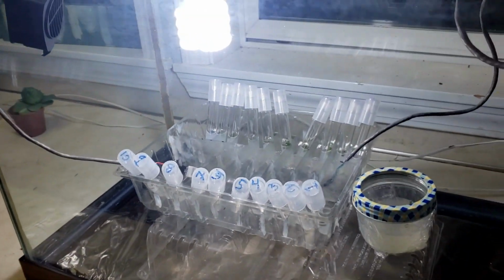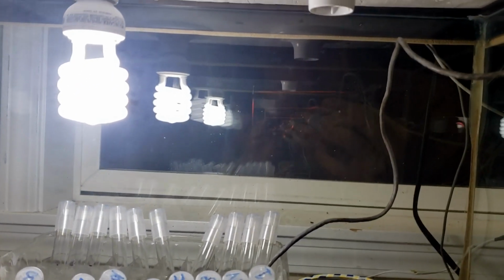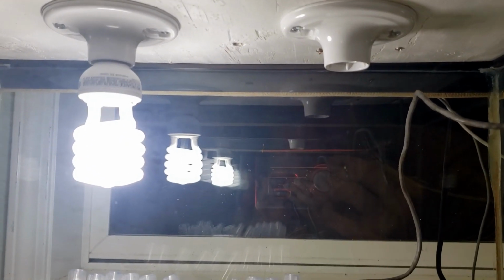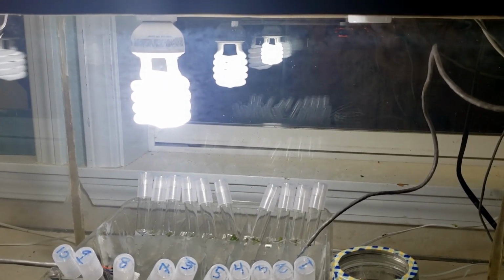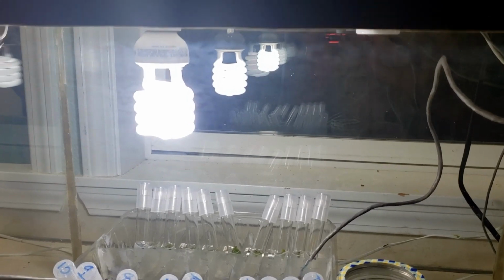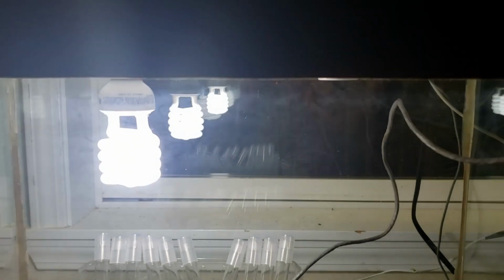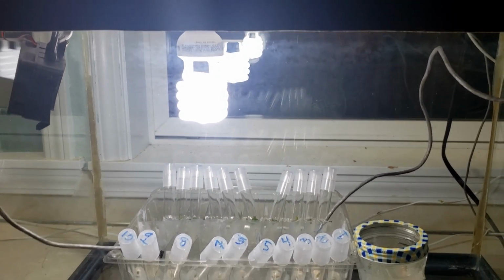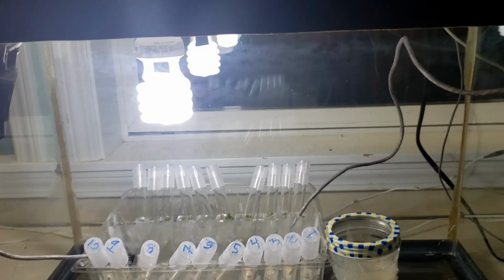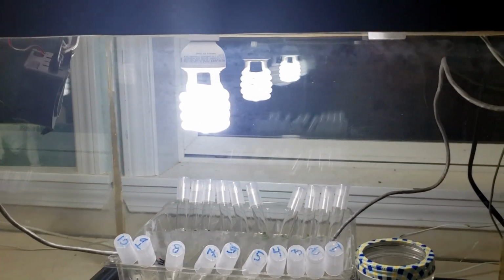We'll see. So for starters, probably the most noticeable thing is the light. I actually have two sockets for light bulbs. That is a 100 watt, 6,500K fluorescent bulb. And I had two in there. But that was a bit overkill. It was overheating the box. So I took one out, and 100 watts is still plenty for this size. Really, I only need 80. So that's just fine. And that's all controlled up here with the electronics.